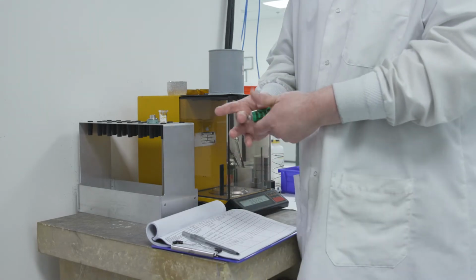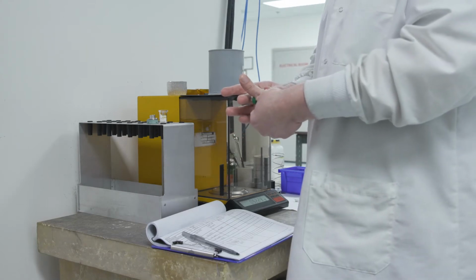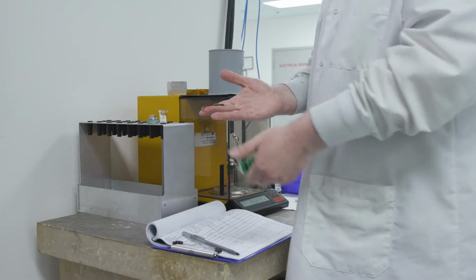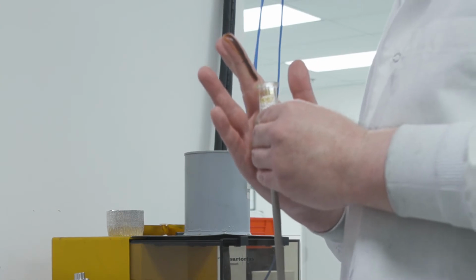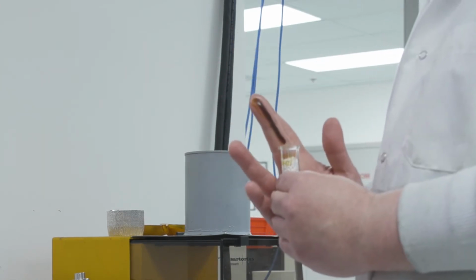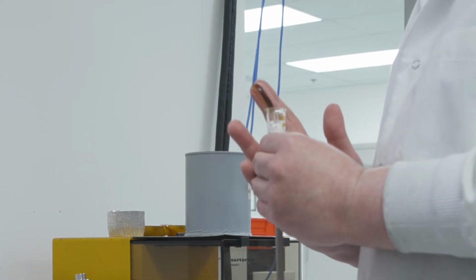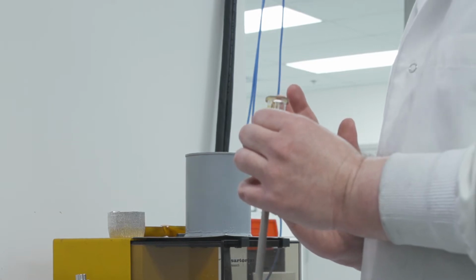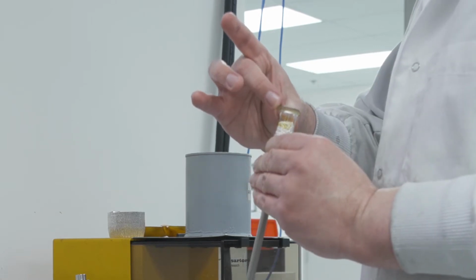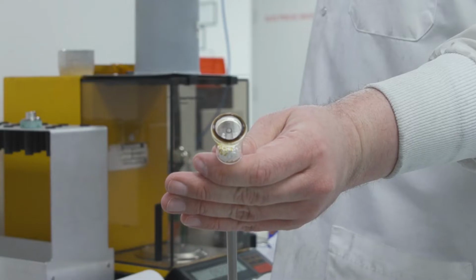Chris starts by placing a line of the Apiezon H grease on his finger. He's going to apply this grease in a thin line along the outer edge of the top surface of the penetrometer by rotating and lifting the penetrometer along the line of grease on his finger. He moves his finger around the outer edge of the penetrometer to remove any excess grease. Notice the nice even line of grease around the top of the penetrometer.